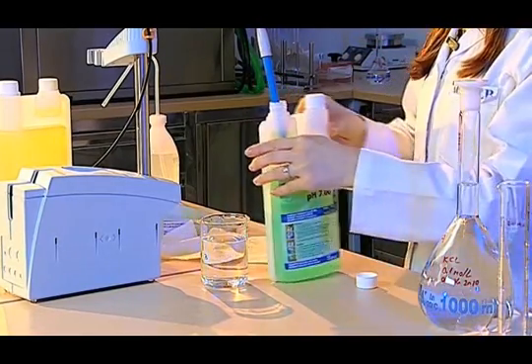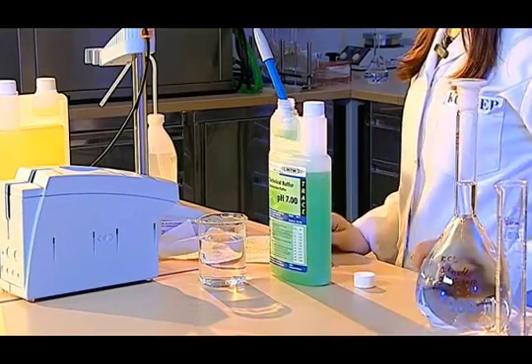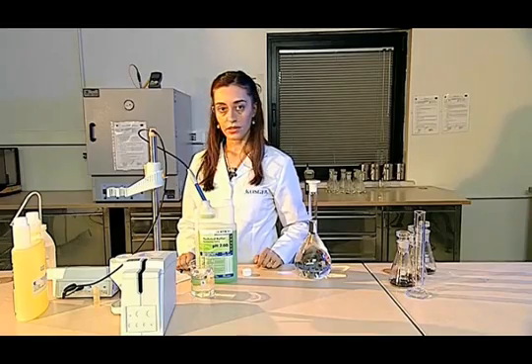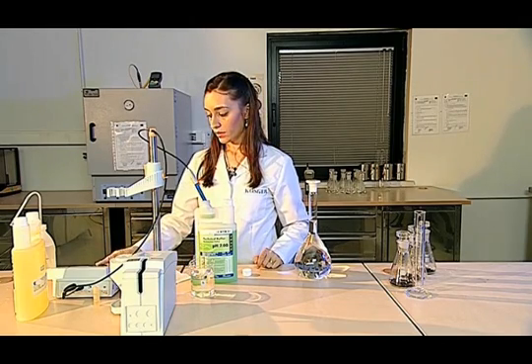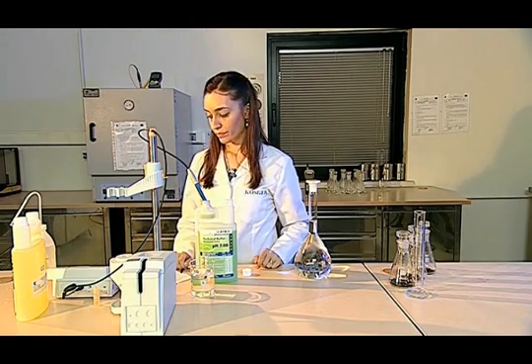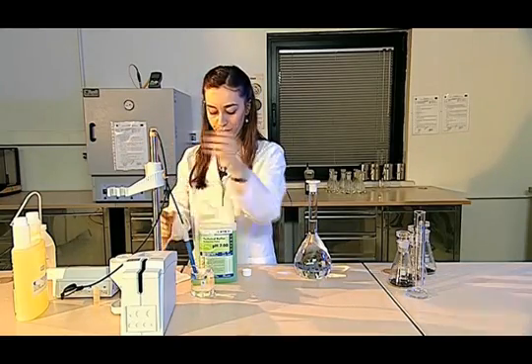In the same way, I look at the correspondence of the pH with its observed temperature, and if I observe that it is suitable, I say there is no problem. I observe the value on the screen, and I complete the calibration of the pH meter.